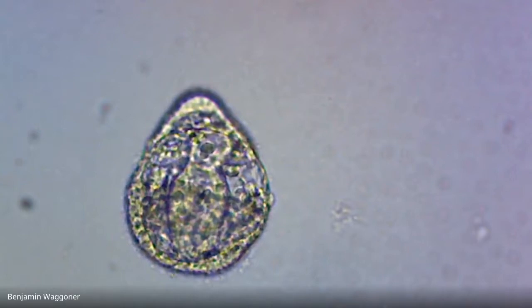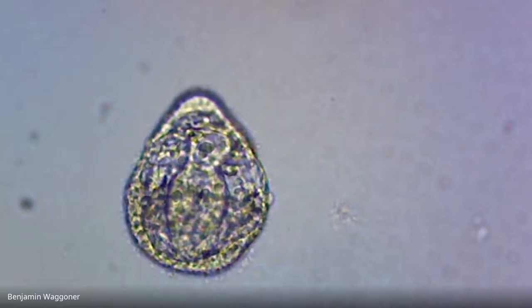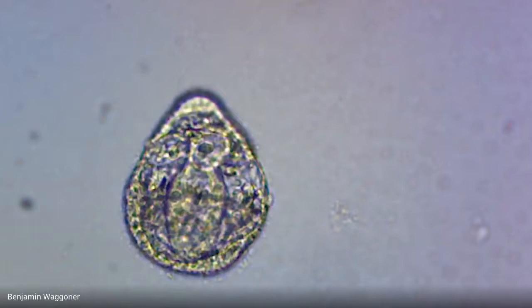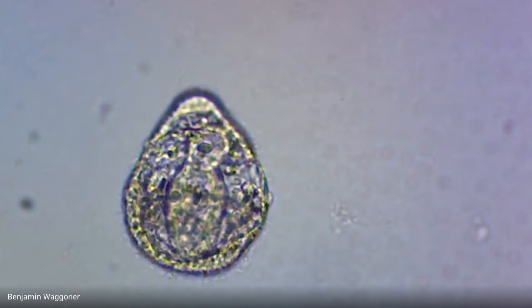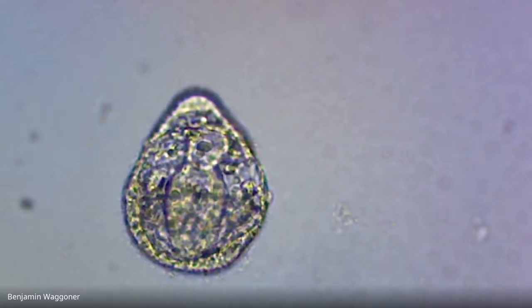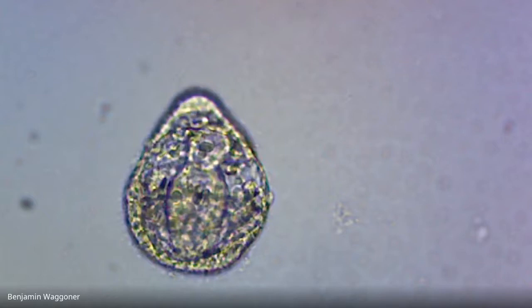You can also at least record the number of larvae that we saw that look weird. There was a bunch that I said were trashed or otherwise abnormal. Again, it can be hard to tell if they're degenerating just because of bacterial attack or because of the nickel. But at least we can present that, even if it's not data as nice as we would like. So what I'm going to do is stop the recording for now and declare this experiment a partial success.